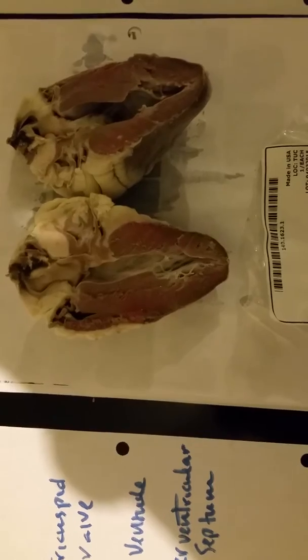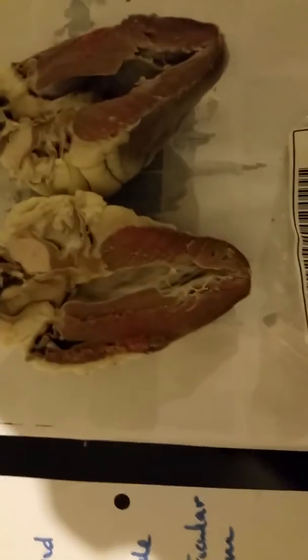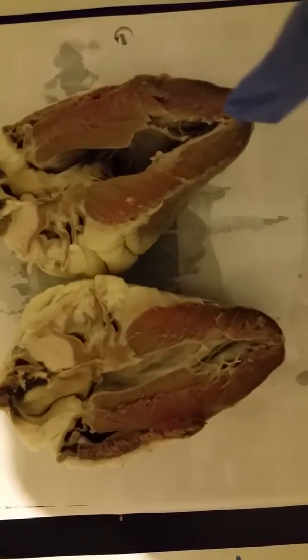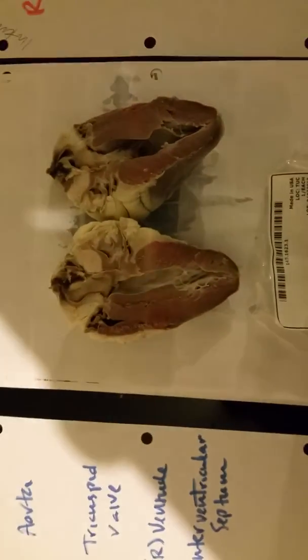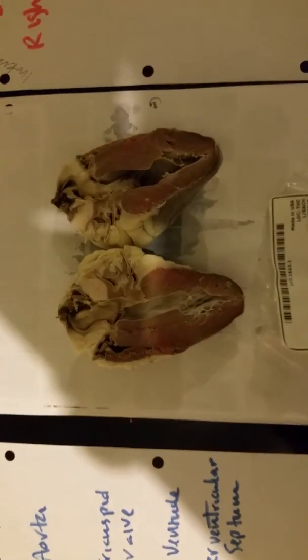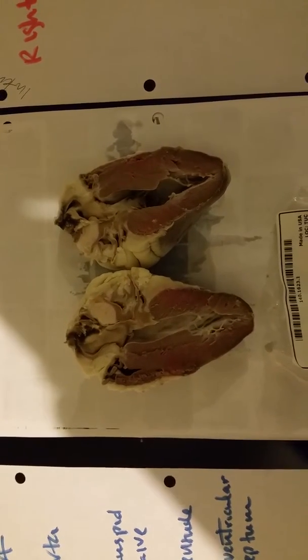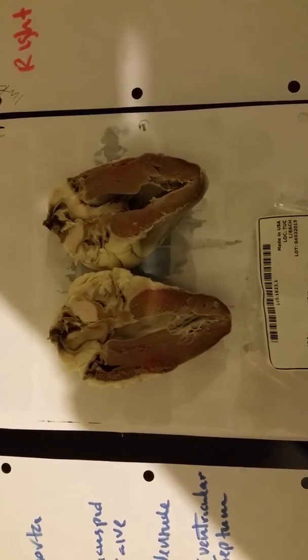So let's talk about the myocardium. The myocardium is so much thicker, as you can see, just by looking at the two ventricles. The two ventricles are right here, and then you can see that the myocardium by itself, just this piece right here, is so much thicker. Well, we understand that we have myocardium, endocardium, and pericardium, and those are the three parts of the heart. And we want to make sure that the strongest part of the heart, the myocardium, the muscle, is able to effectively pump.